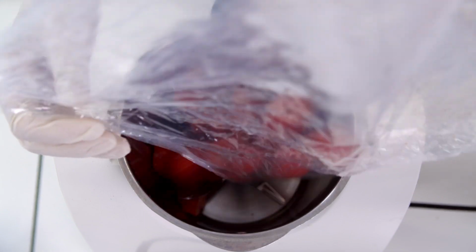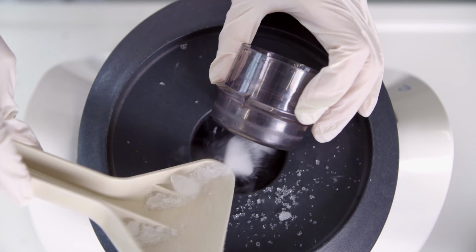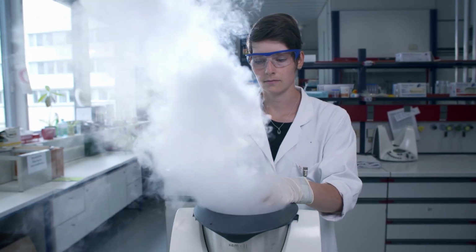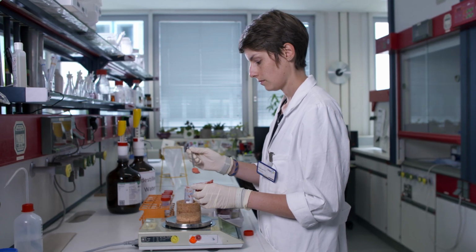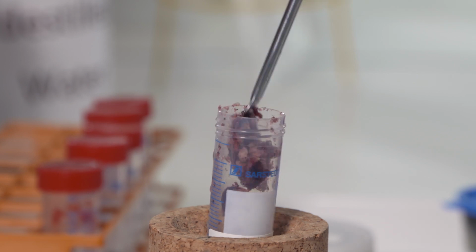After being frozen for around 12 hours, the roughly cut samples are homogenized with dry ice in a mill. The homogenate is filled into containers and stored frozen until the analytical portions are taken for the actual analysis. So the method, compared to previous methods, was quite quick and also quite robust, also safe because the entire procedure is in a closed vessel.